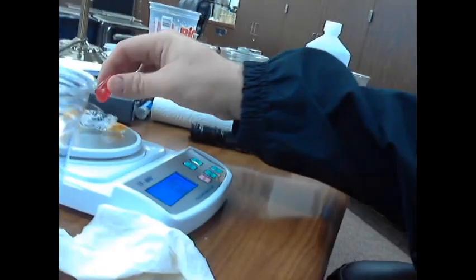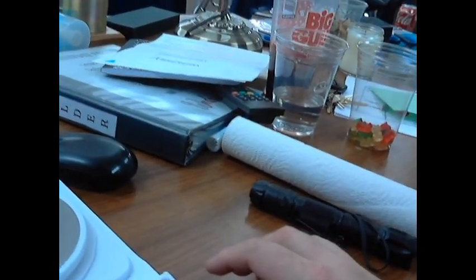And we want to get this all off. We want to get all the moisture off. Okay. And this red one, gotta use the 2 hands to get these little bits of paper towel off. That'll work. Okay, so right here we've got this. We're going to put him back onto his wrapper, and this is at 6.24.